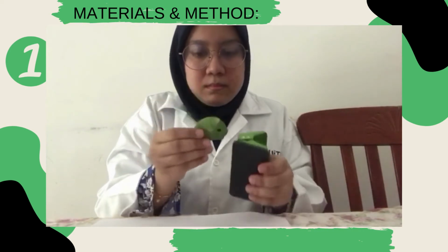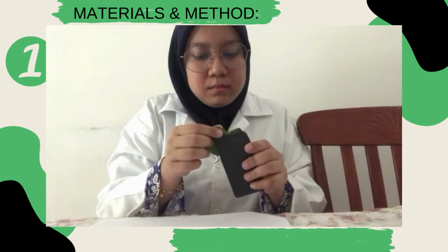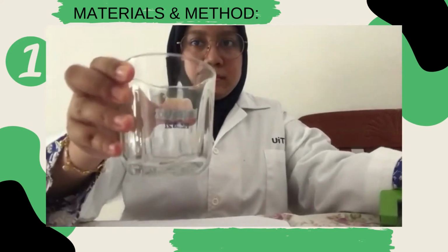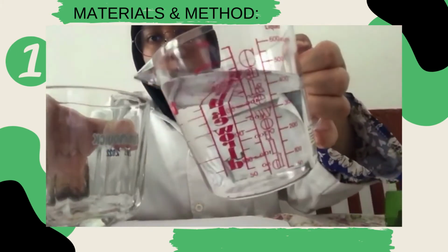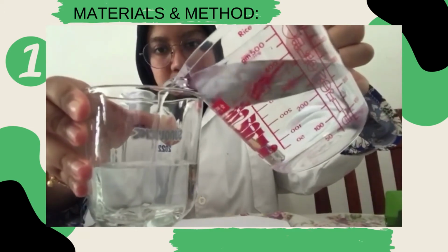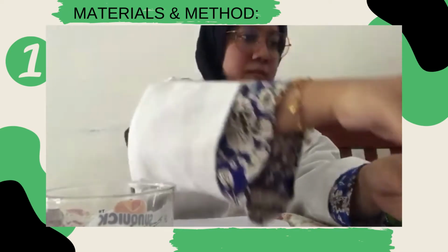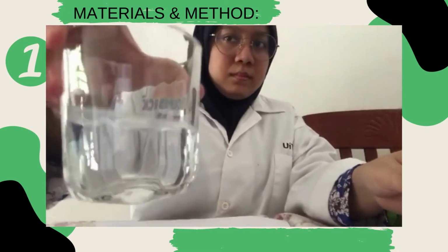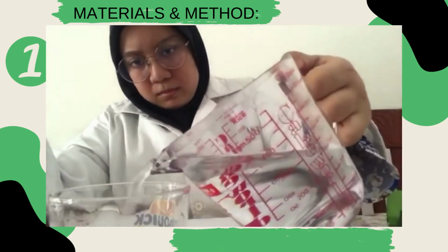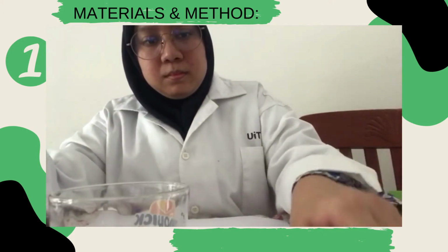First of all, I choose a bougainvillea plant. Using a hole punch, I get 10 leaf discs from the plant. After that, put water from the beaker into the glass, 50 ml of water. And then, using a small spoon, put 0.5 grams of baking soda into the glass and mix it.